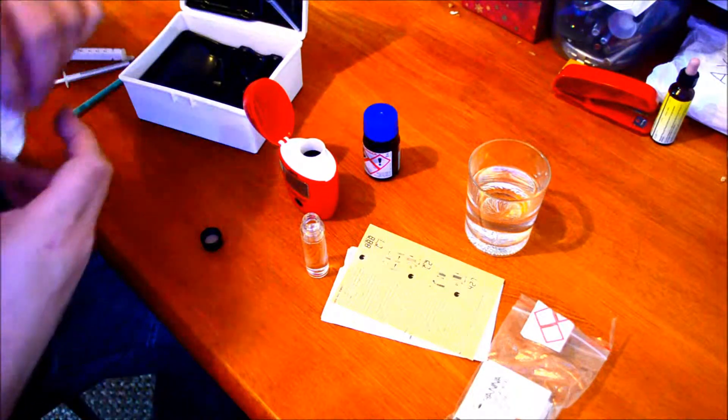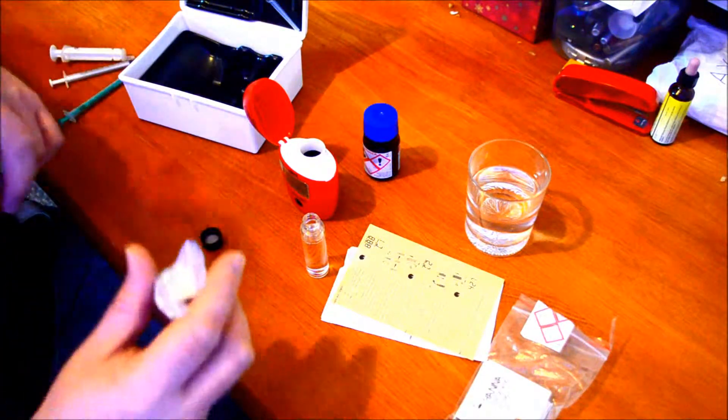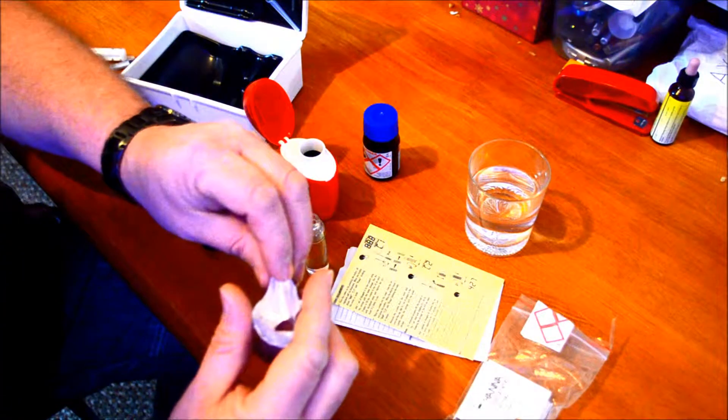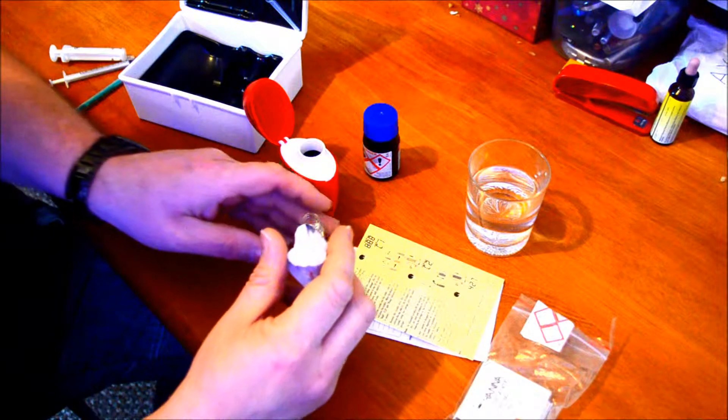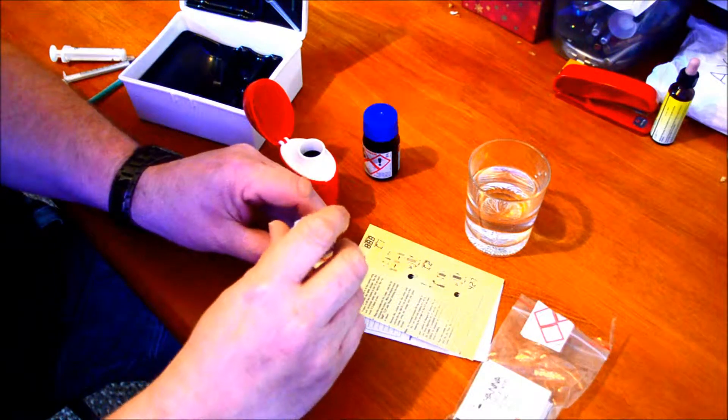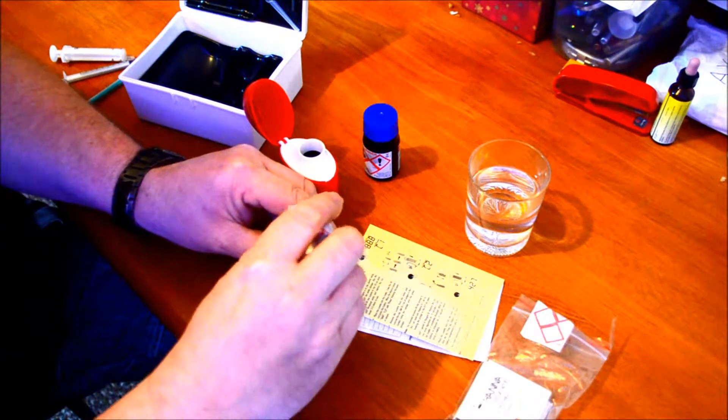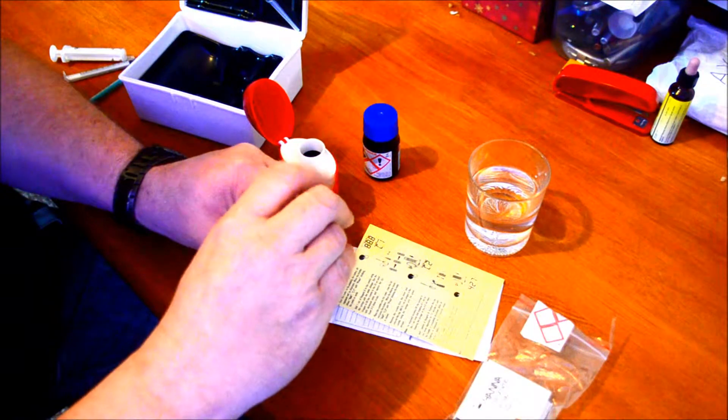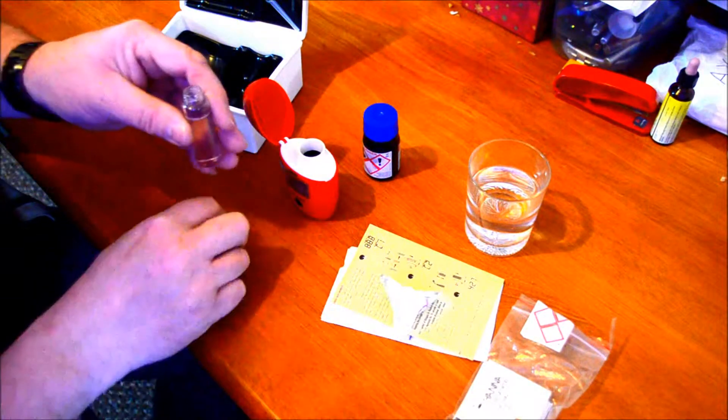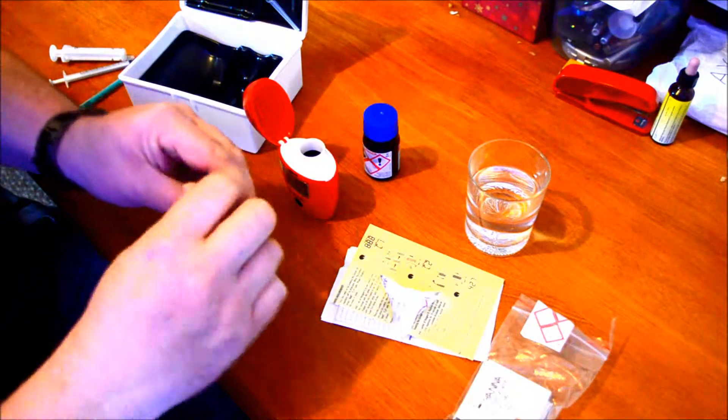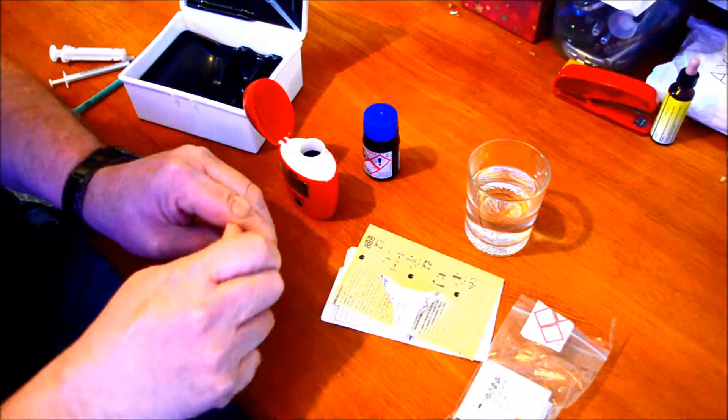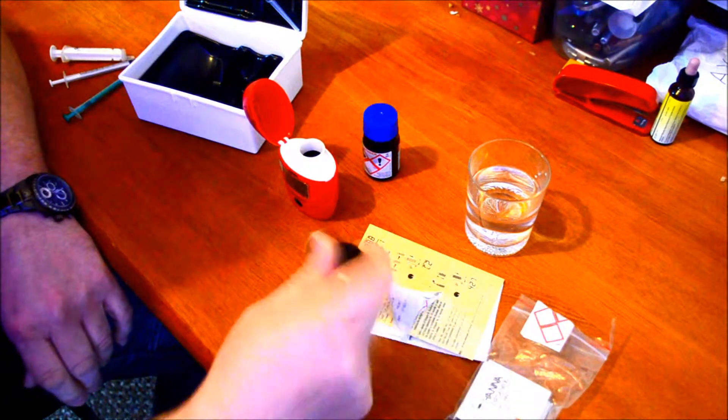And then you have these crystals that come in a sachet. I always pre-tear it ready because the checkers do time out after a couple of minutes and the display switches off. I'll put them in there and give it a shake for 15 seconds or so.